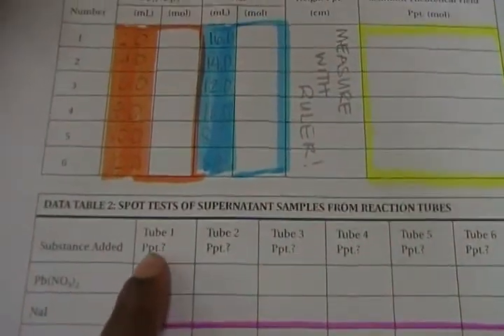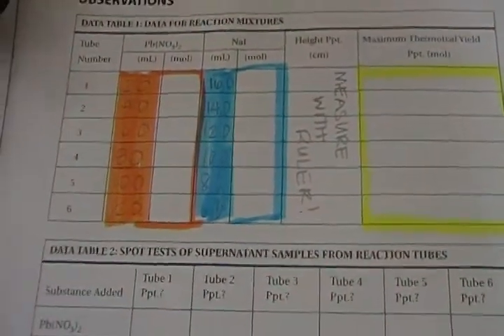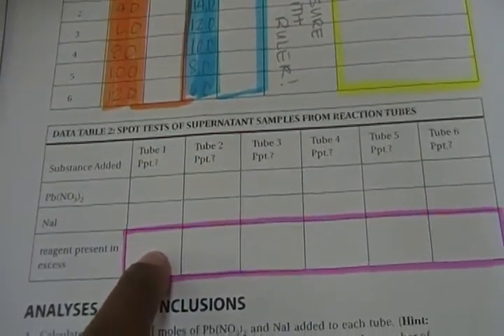So on your lab sheet, we're now looking at the pink area, well actually above the pink area, where it says test tube 1 precipitate by Pb(NO3)2, you would write yes, because we can clearly see that the precipitate formed, it got cloudy. By substance added KI, that should be KI there, so make that change, that should be no. The reagent present in excess. This is the part that you'll have to think about after the lab, but pretty much it works out to be whatever you add, it's the opposite thing that's in excess, because the drop, the supernatant, had to react with whatever you added.